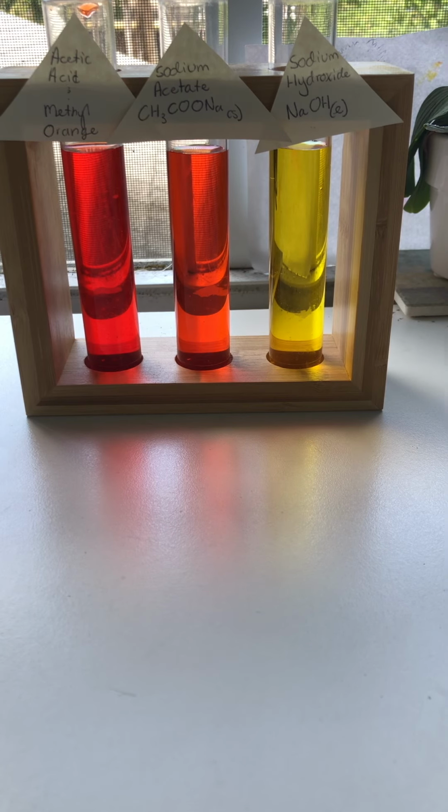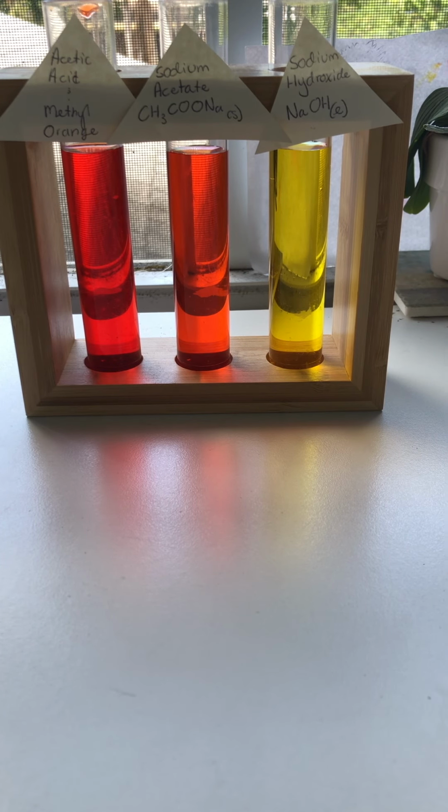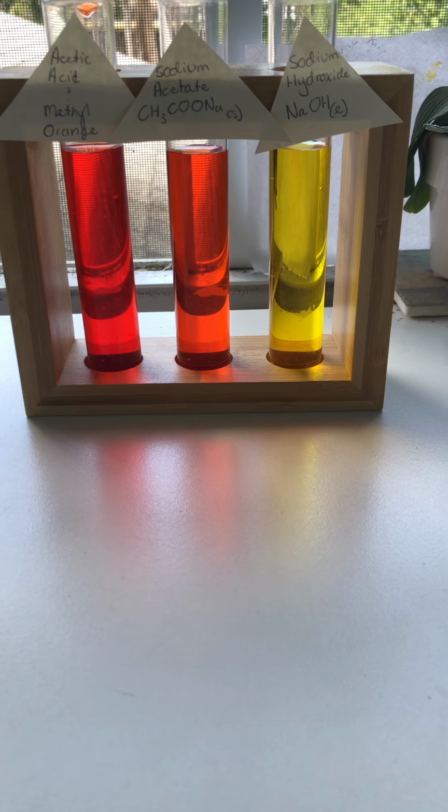So looking at acetic acid with the addition of methyl orange, which is just an indicator to show how acidic or basic something is. Since acetic acid is a weak acid, it'll have more of a reddish color to it, so that means its pH is below 4.4. So starting with this somewhat weak acid, we are going to add sodium acetate, which is slightly alkaline, so that causes the color to become more of an orange. So here we see that there is a shift to the left because the ion is added to the product side, so the equilibrium has to shift to the left to maintain its balance.